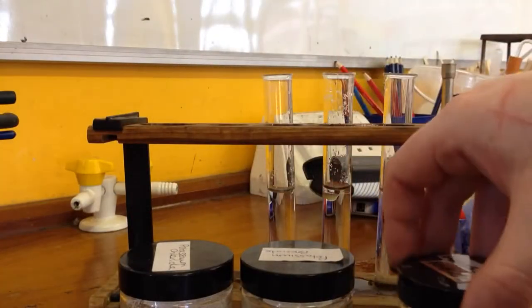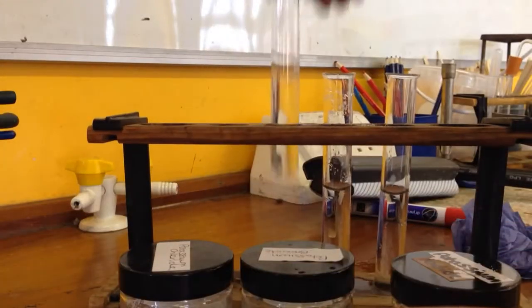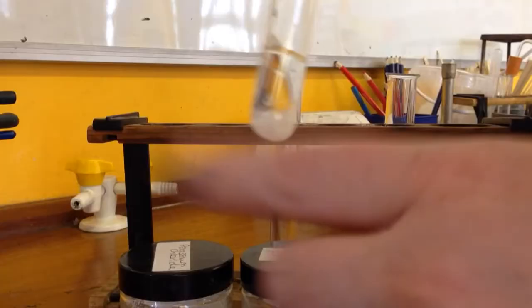So I've got potassium chloride, potassium bromide and potassium iodide and then just give them a quick shake to dissolve the salt in there or just get as much of the salt as you can dissolved.